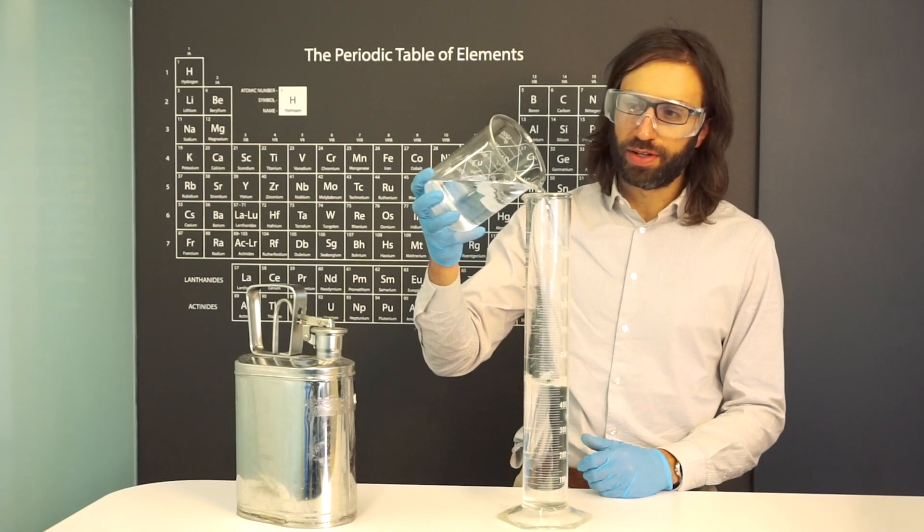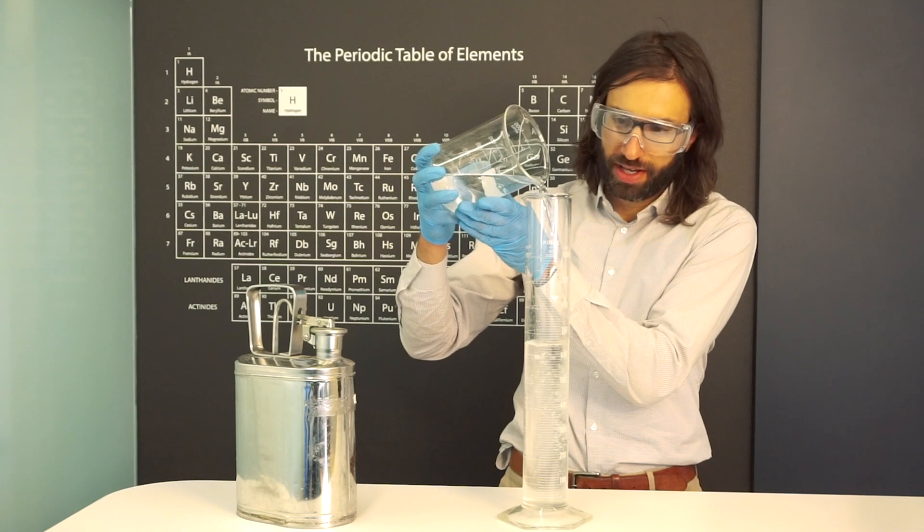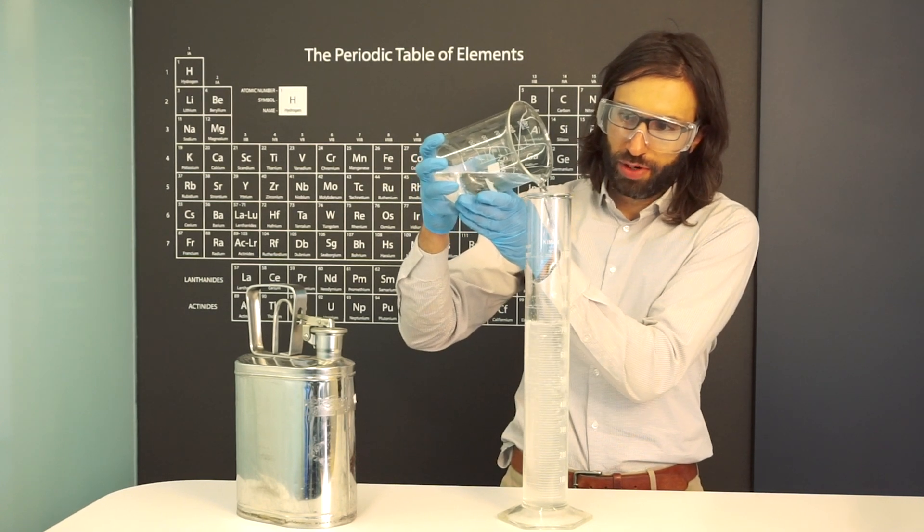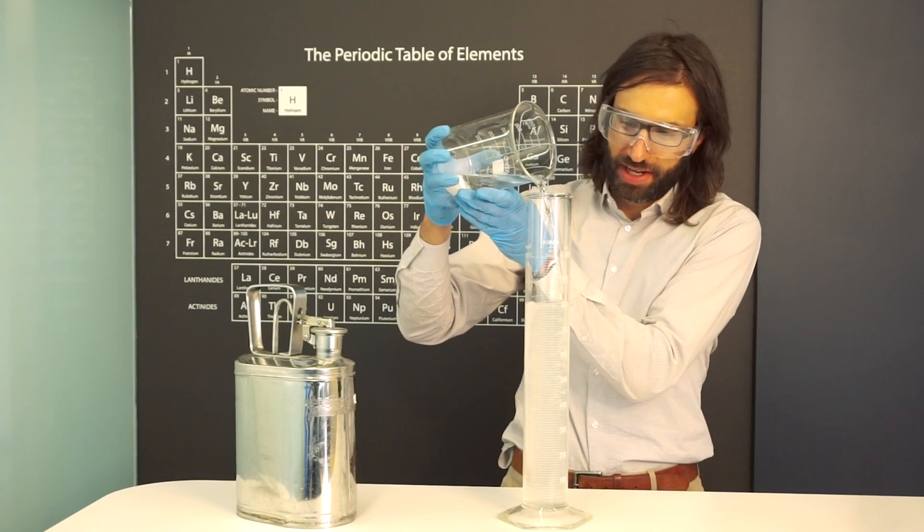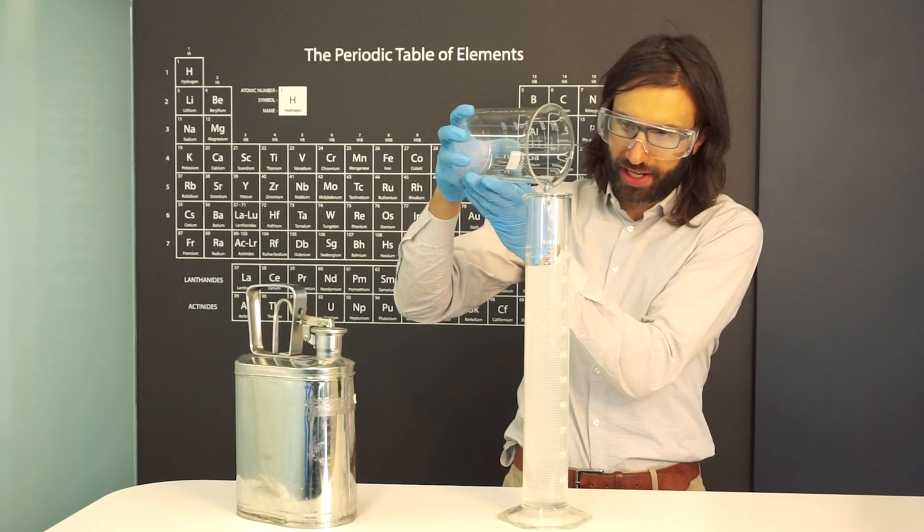Water is heavier, more dense than ethanol. So by putting the water in last, they're going to mix. The water is sinking in the ethanol.